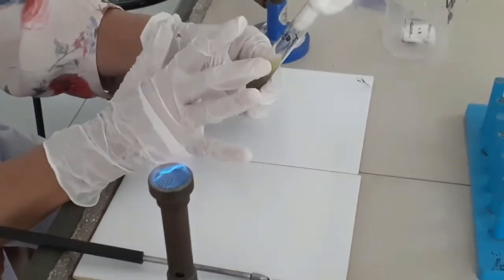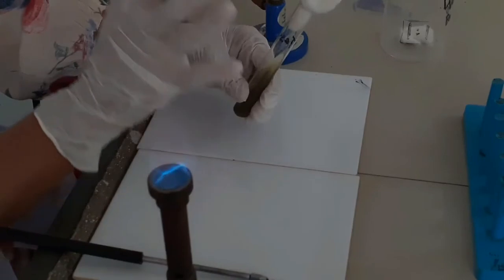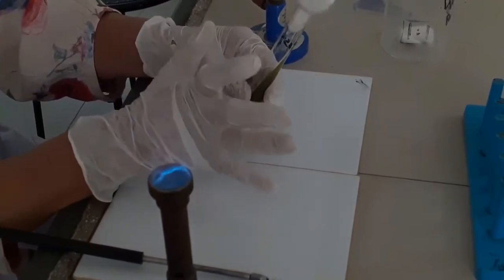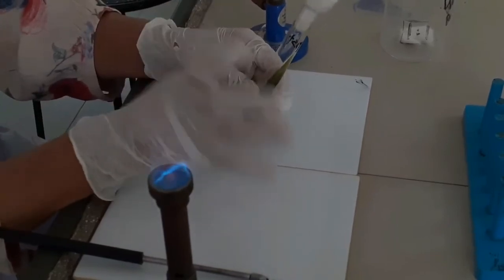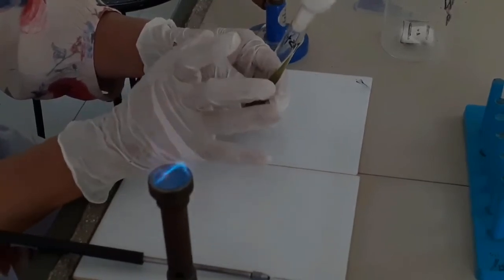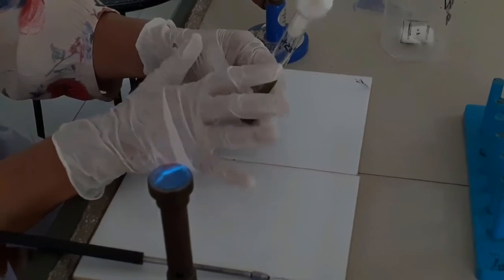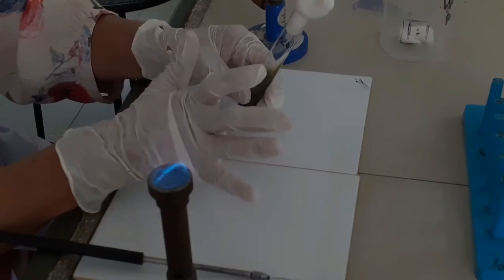Biochemical tests are used to identify the metabolic reactions that occur in biological organisms, and these organisms involve specific types of enzymes which are responsible for the utilization of a particular nutrient source and generate a specific type of metabolic product. So we can identify a specific metabolic pathway by a biochemical test. Biochemical tests are very important for the identification of microorganisms. So that is all about this test, the citrate utilization test.